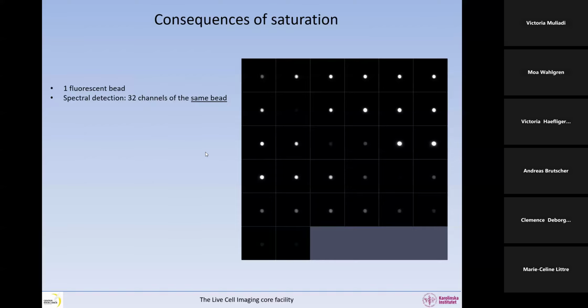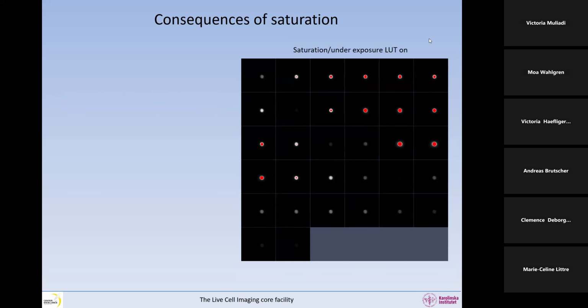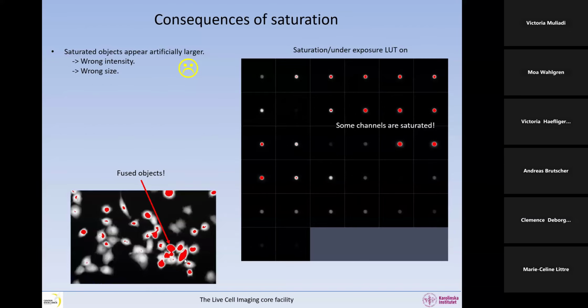So clearly, all these beads should have the same size. But if you look at two different images here, it's the same bead, but in different areas of the spectrum, you can see that this bead is bigger. They should all have the same size, considering that it's the same bead. Well, if we apply the saturation and underexposure lookup table, we can see that some of the channels are saturated. Saturated objects appear artificially larger than they actually are. So not only are you getting the wrong intensities, but you're also getting the wrong size, okay? And on top of that, if you have objects close to each other, when they are saturated, because they are artificially expanded, they also start fusing with each other. And therefore, if you count the objects, you will get the wrong number of objects, right?